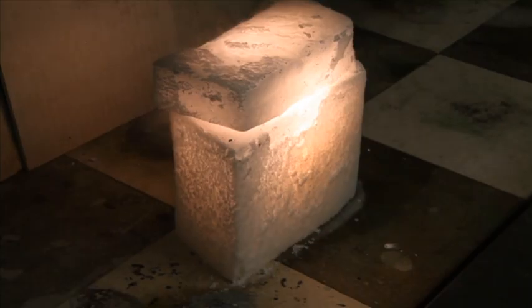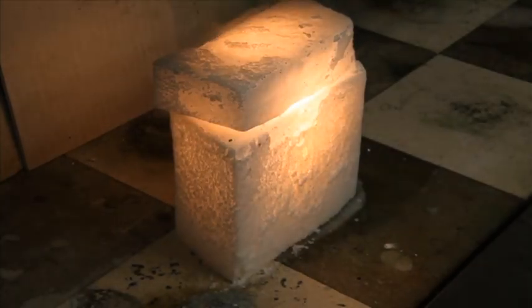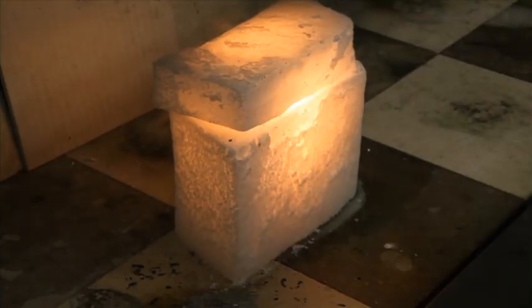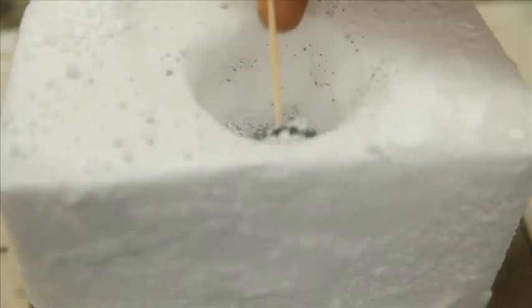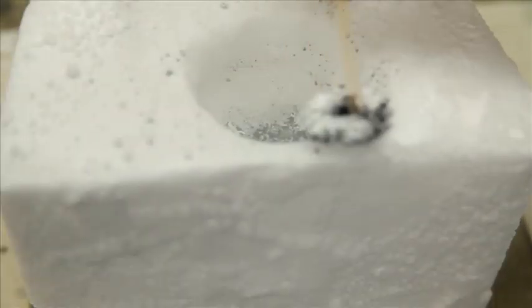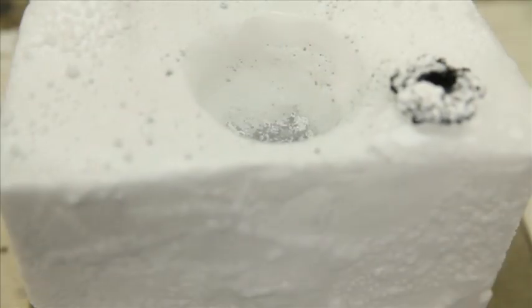Dry ice should be handled with insulating gloves and goggles should be worn. Wearing a lab coat will reduce the risk of burns from any burning magnesium that may be ejected. Never store dry ice in a sealed container or use it in a confined space. It should not be transported in the passenger compartment of a car unless the windows are open.